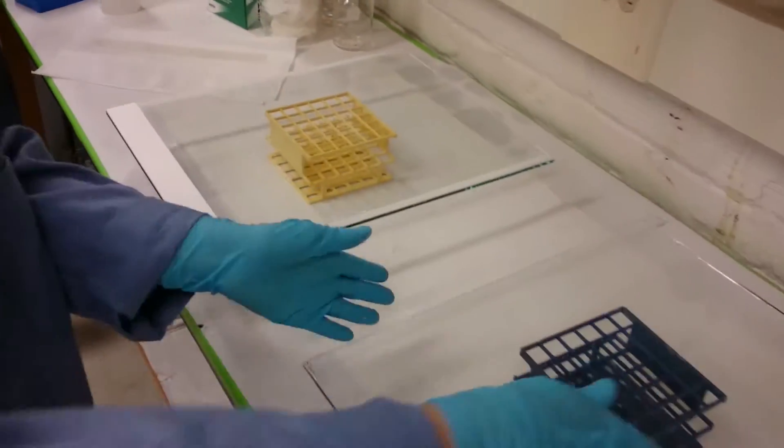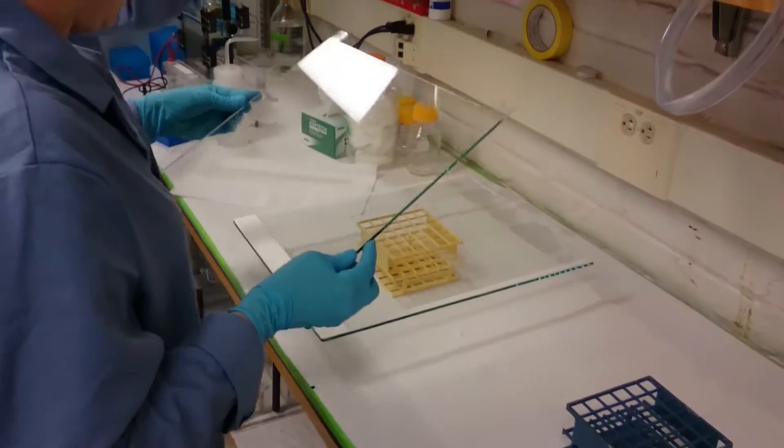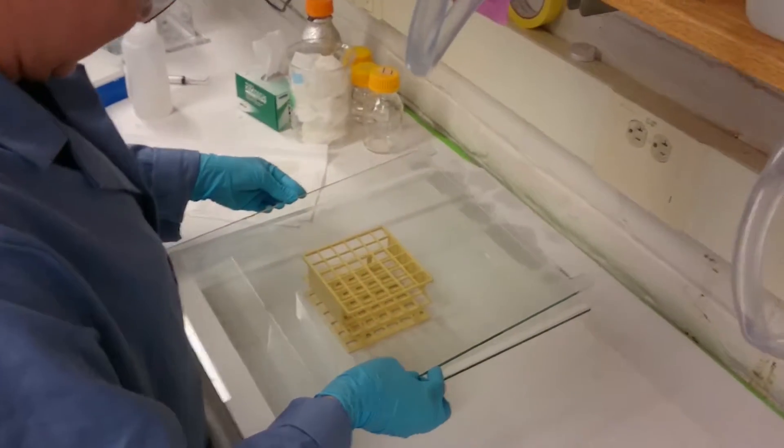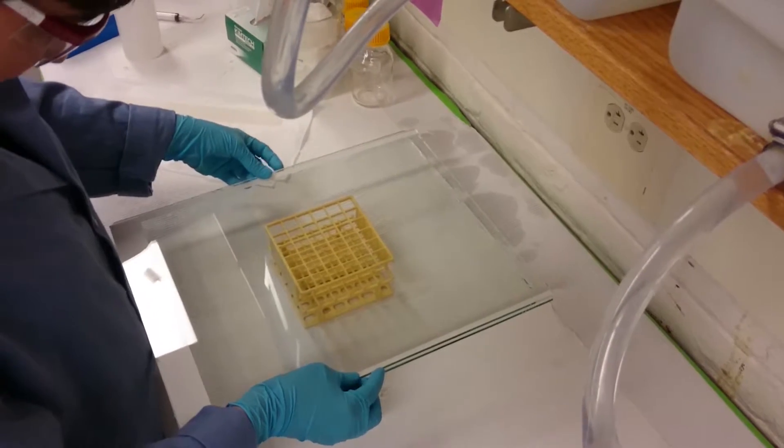Okay, so that's good now. So now the top plate. To get it on cleanly, you really have to hold it right at the edges so that you don't move the spacers more than necessary when it goes down.